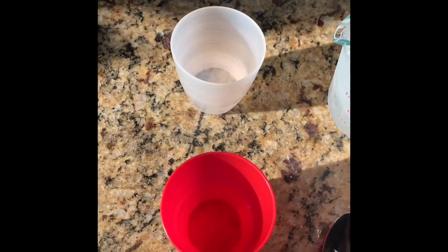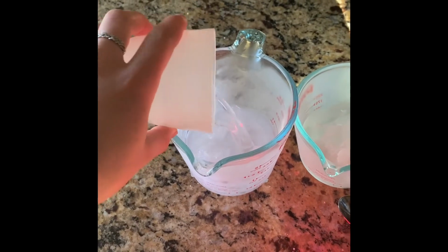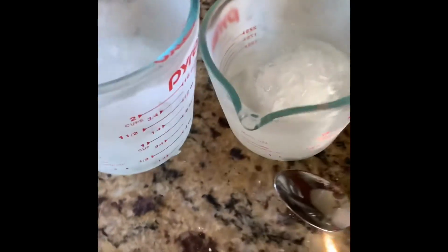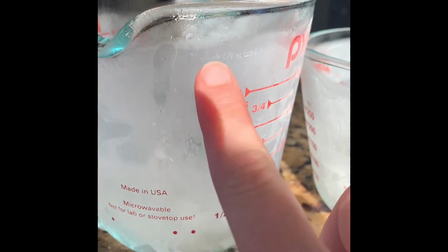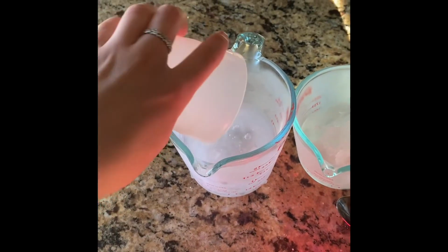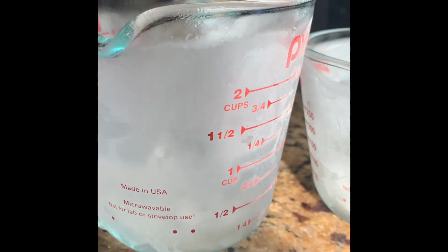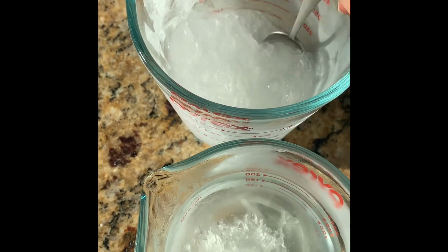So I'm going to add water here, the same amount to each one at the same temperature at the same time. What I'm assuming is that when I'm adding water, there's going to be a heat exchange between the liquid water and the solid. Heat's going to flow into the frozen sample, and there's not going to be a temperature change because at a phase change, there's no temperature change. But I'm hoping to show which one will have a lower freezing point, because the one that is exposed to the same amount of heat but melts first, we're assuming has the lower freezing point because it needed less heat to melt.